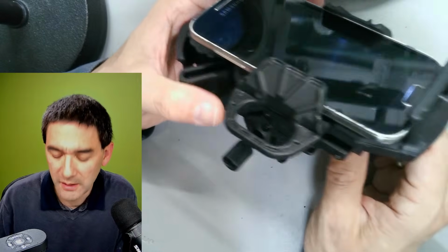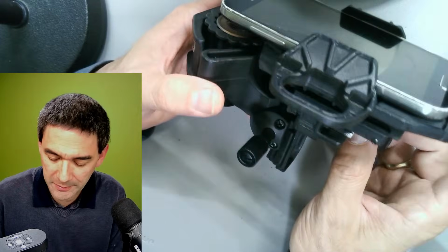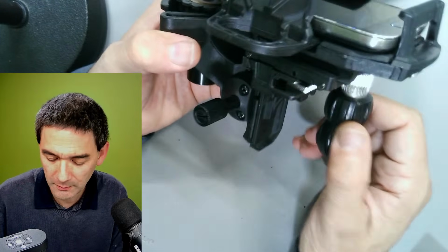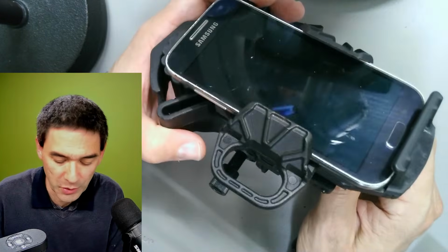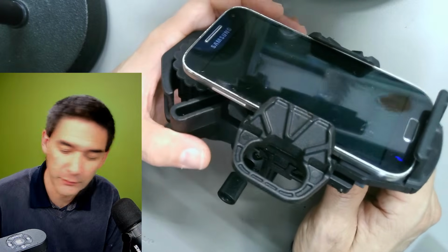Okay, so that is the Celestron one. Also an interesting idea, but there are, I would say, cheaper ones available as well. And if you just clamp everything tight, then it should also work. So I would like to show you now my favorite one.